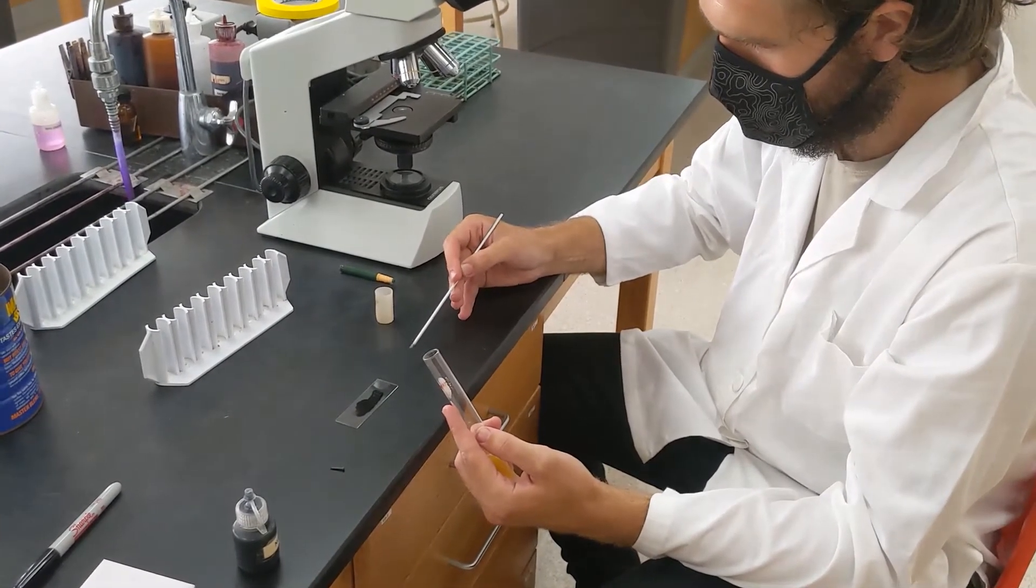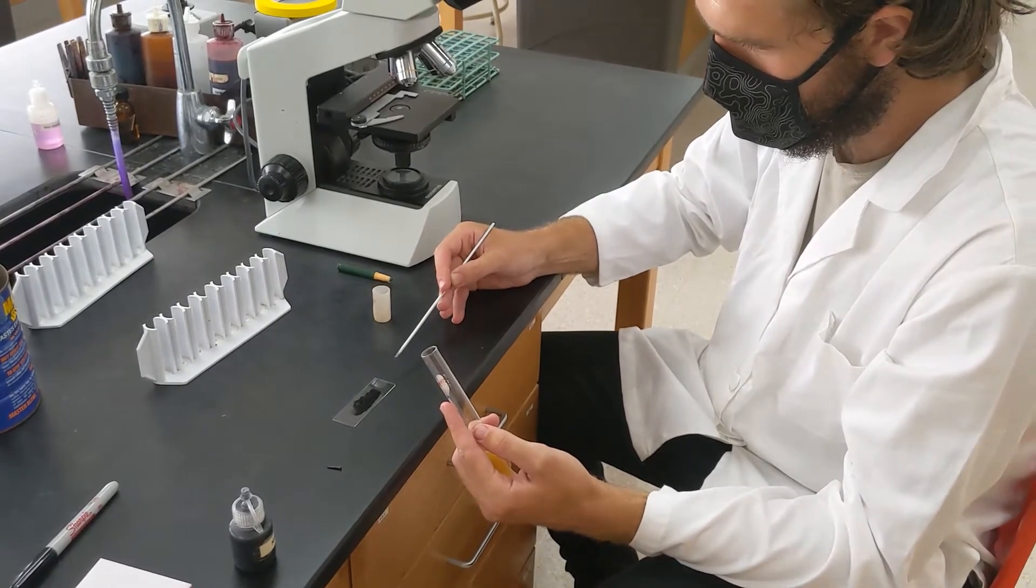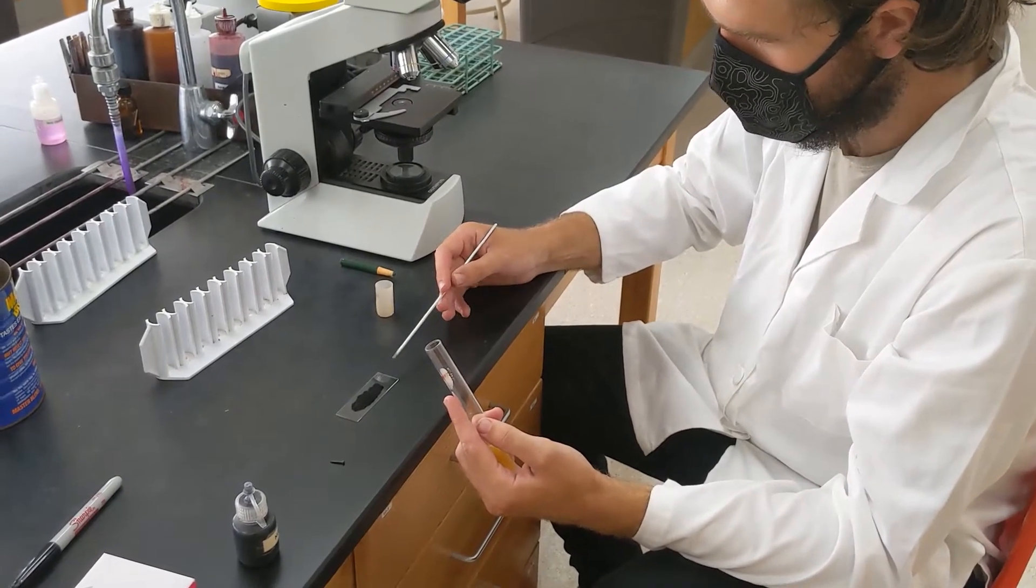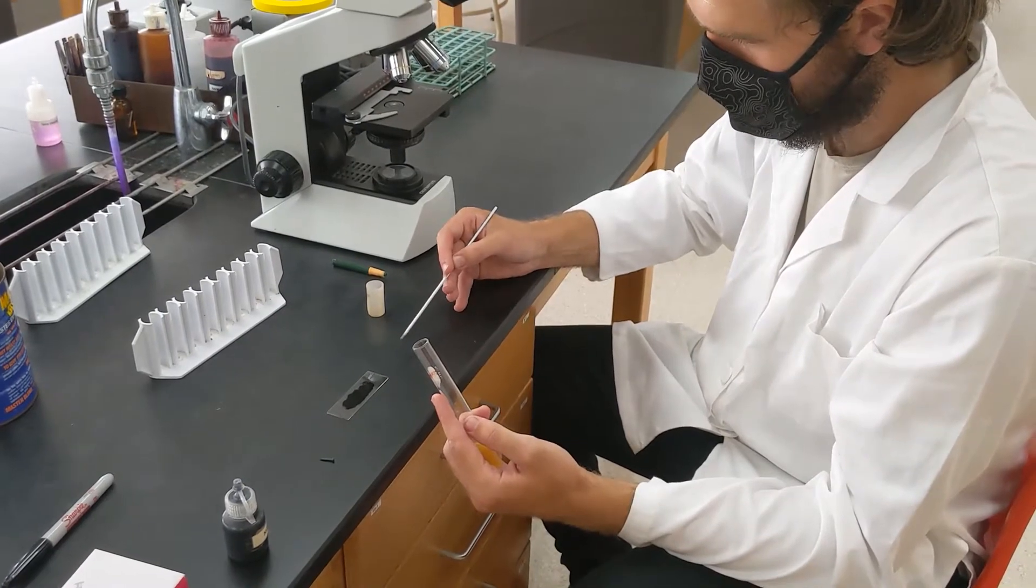This is important because we're not going to heat fix this sample, we're just going to let it air dry, so this helps to let it air dry quicker.